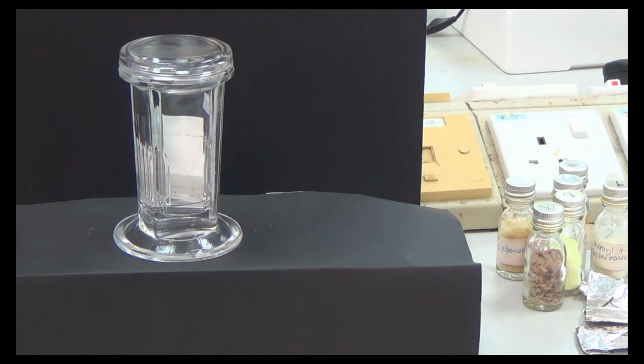Okay, so the idea is this. Needs explanation while waiting for this. The idea is this: the compound can be polar and non-polar. The one that you spot can be polar and non-polar. Although we can dissolve it in dichloromethane, which is normally non-polar, when we say polar and non-polar, it's not like 100% polar or 100% non-polar. It's more like a combination of polarity. So one compound may have polarity 90%, like that. So it's not like a compound is totally polar or totally non-polar.